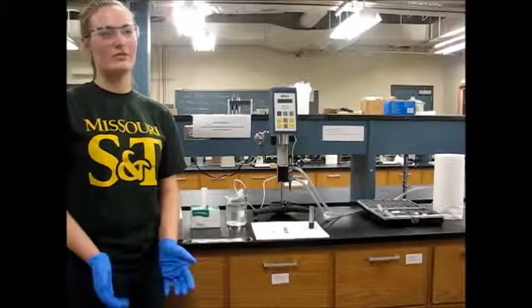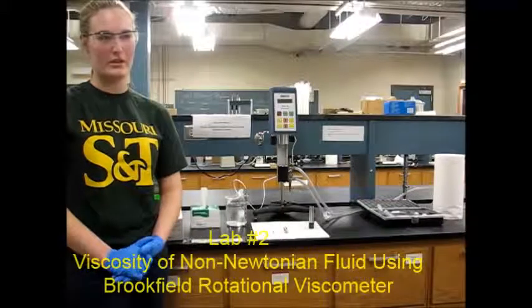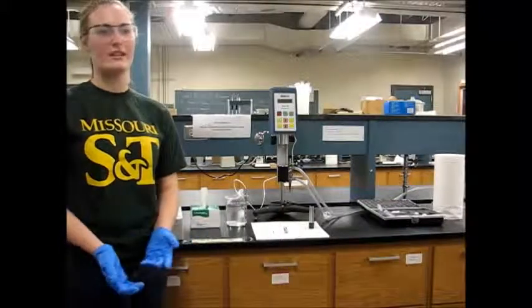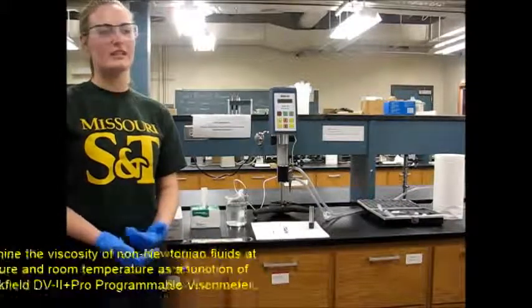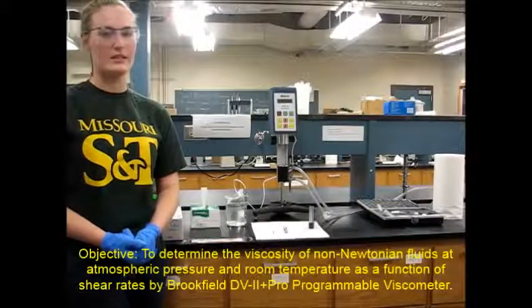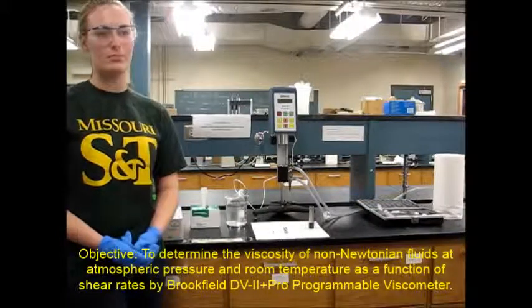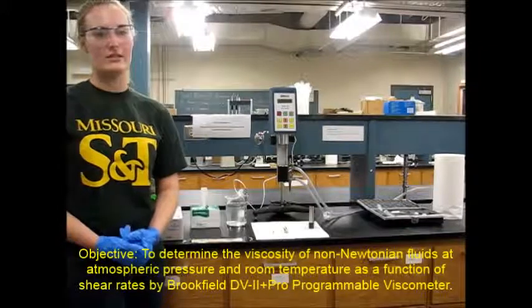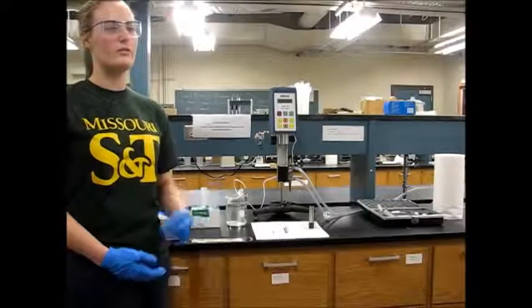Welcome to Lab 2, Viscosity of Non-Newtonian Fluid using the Brookfield Rotational Viscometer. As we know, fluid viscosity is defined as the internal resistance to fluid flow. The objective of Lab 2 is to determine the viscosity of a non-Newtonian fluid at atmospheric pressure and room temperature as a function of shear rates using the Brookfield programmable Viscometer.